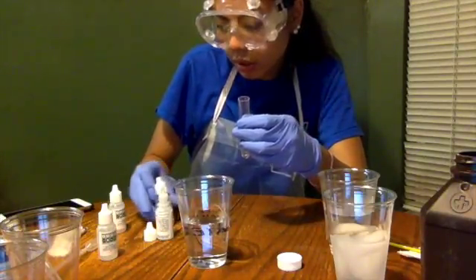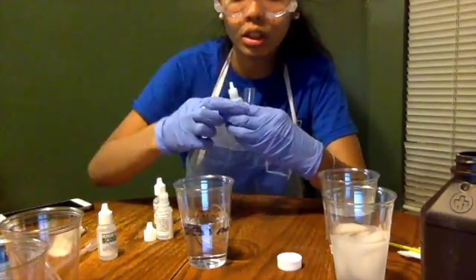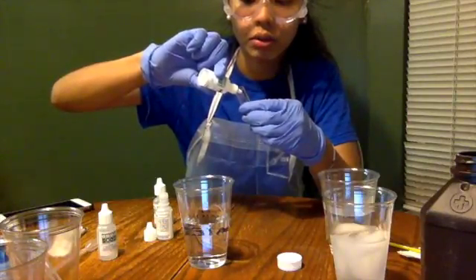And then we're going to take 4 drops of starch. 1, 2, 3, 4.